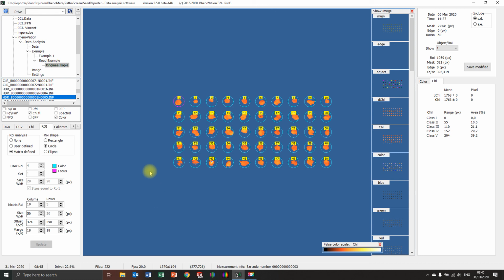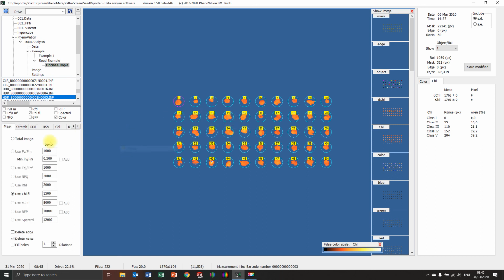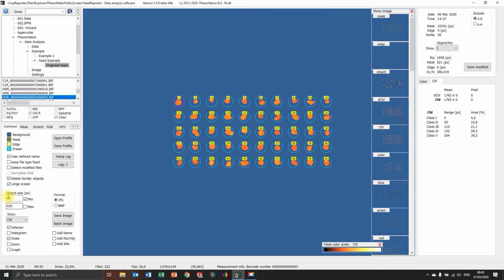Okay, well, I hope I could show you how to get proper data out of the analysis software. Also, be aware that you put the same category of plants or same genotype of seeds in one folder. So this is the total batch, which then say one is brassica, one is pepper, and analyze them accordingly. And always be aware that you look at the chlorophyll percentage, you look at the mask, you say, okay, 1500, put the proper setting in, and then this is really important, the object size. You can really subtract them from the background.